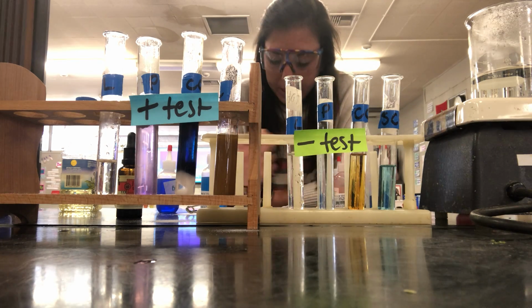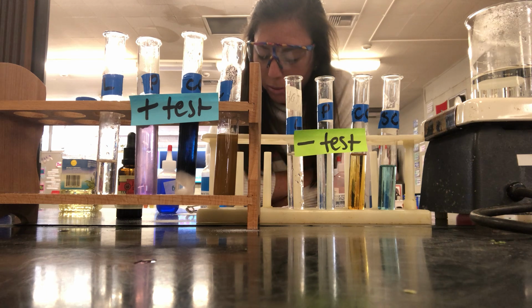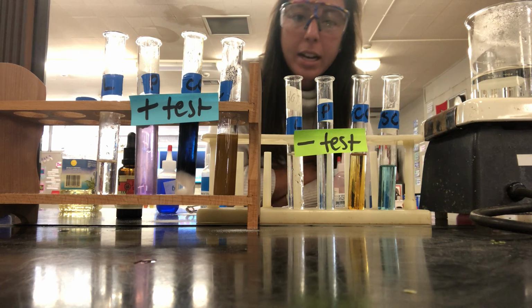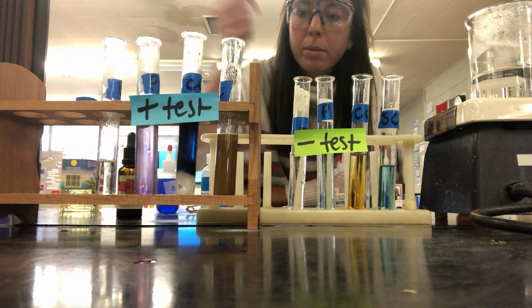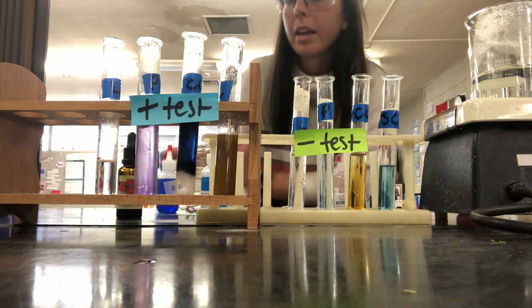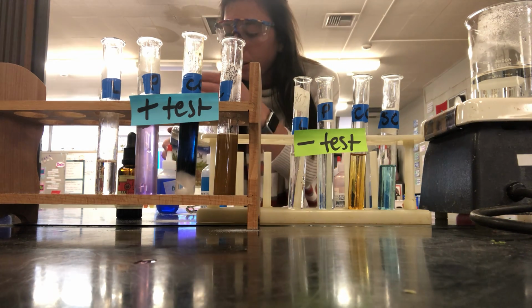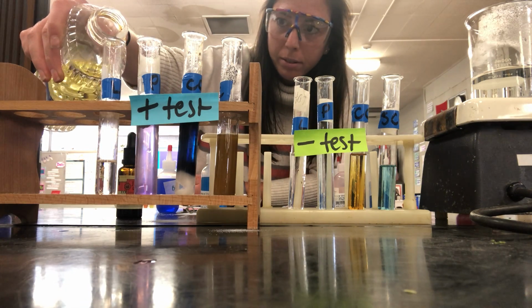But one of the first things it says on here is fill the test tube a quarter full with water and a quarter full with sample. So this is the first one we've had to add something else to our stomach contents. So what I have here is my negative group, and here's my positive test. So I filled it partway full with water and partway full with sample, which for you will be the stomach contents. For me, I'm going to use vegetable oil, which has 14 grams of fat. That's a lot of lipids in there. So I'm going to fill the other quarter with this.